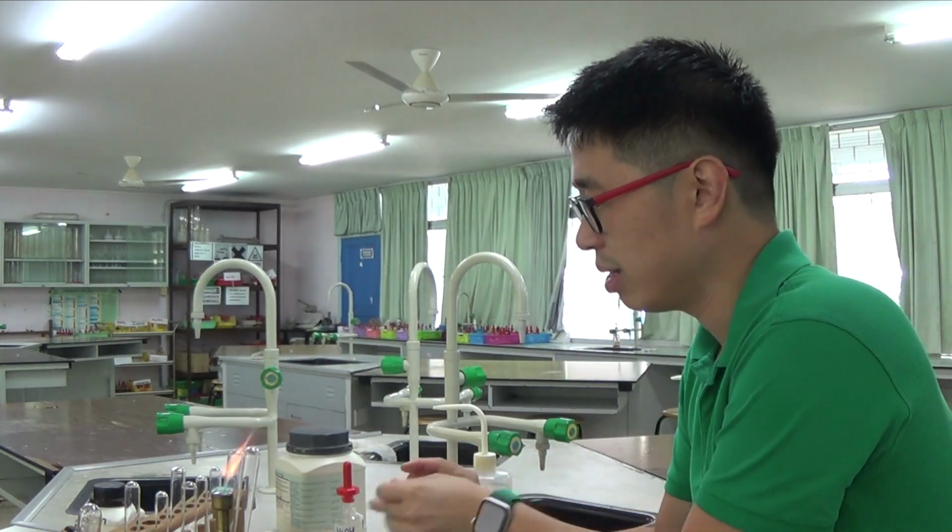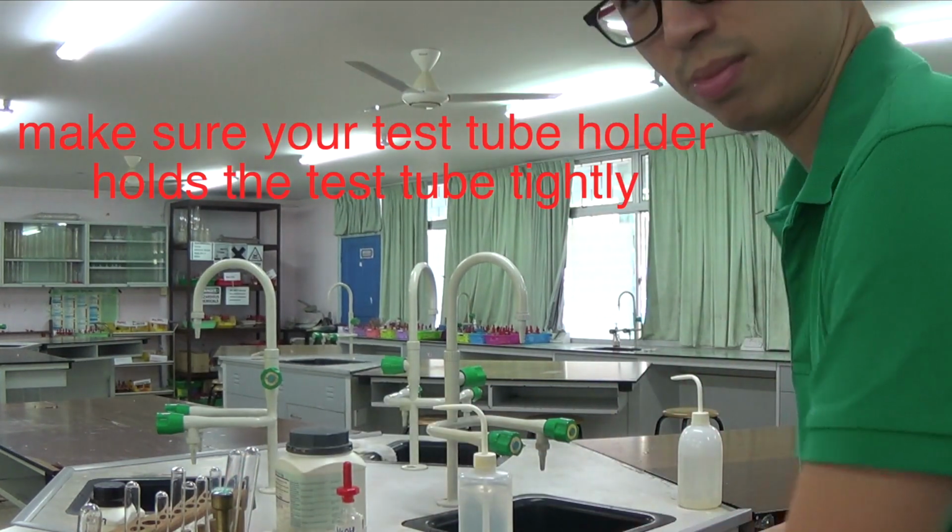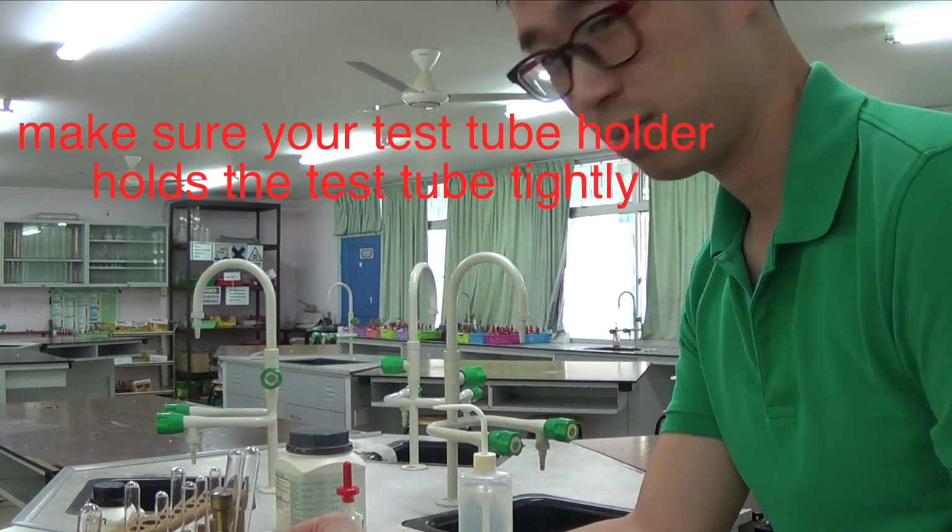So I am right-handed, so I will try and heat this in such a way. Oops, that is not good.